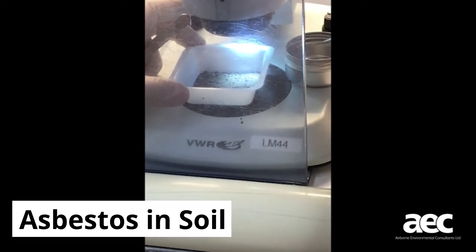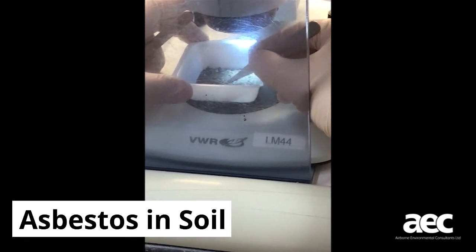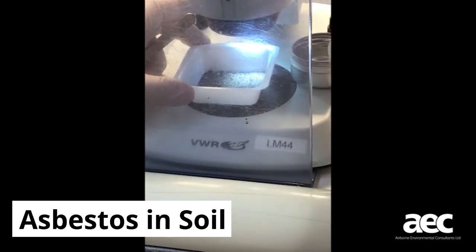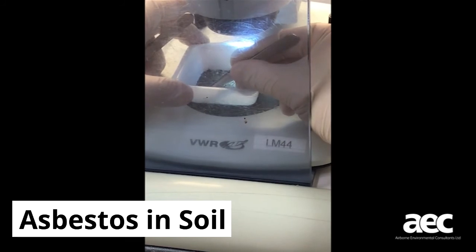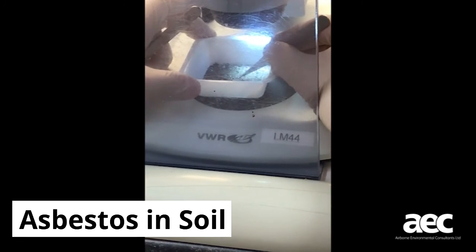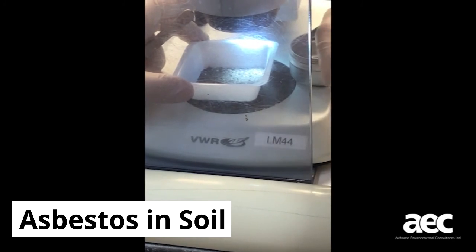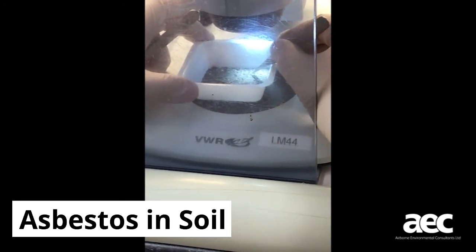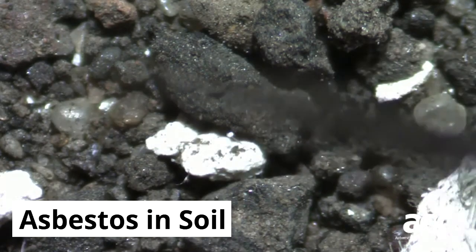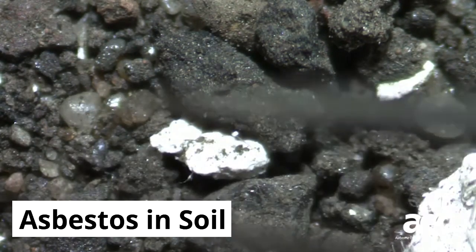Stage 3 analysis would be of particular importance when deciding whether a large volume of soil would be classed as hazardous or non-hazardous waste. This is done through a process of careful weighing of the soil and any asbestos-containing materials identified within, and can also include the mounting of a soil solution onto a microscope slide to allow the counting and sizing of individual asbestos fibres. This in turn allows us to quantify the weight of any free asbestos fibres held within the soil sample.